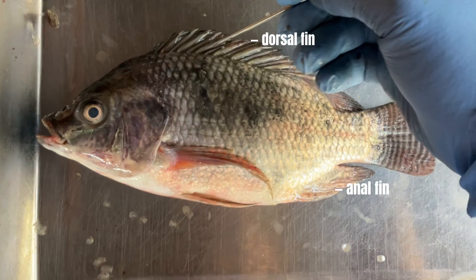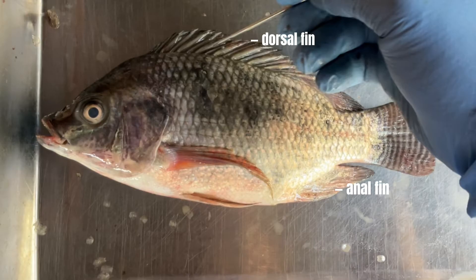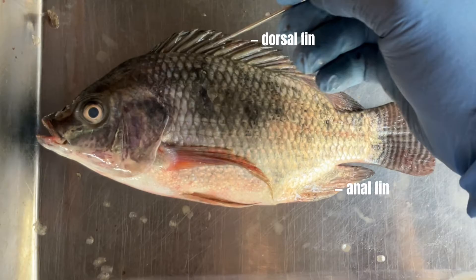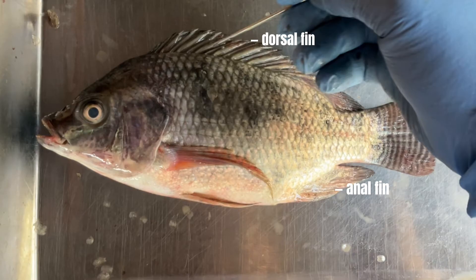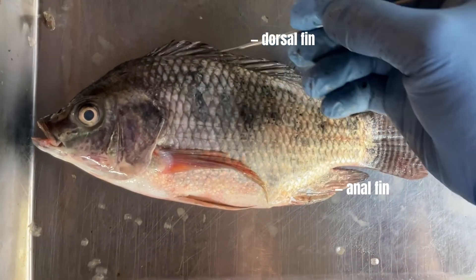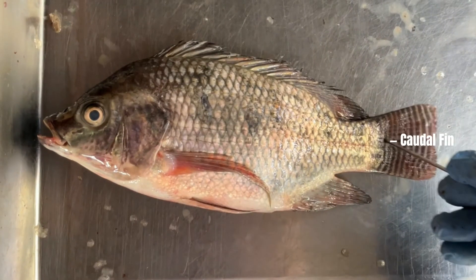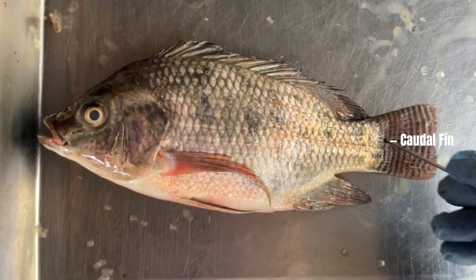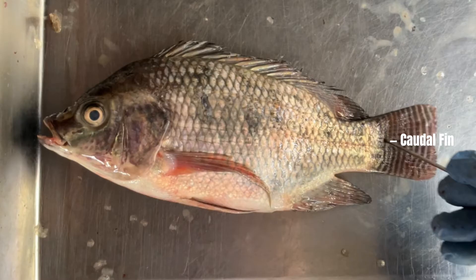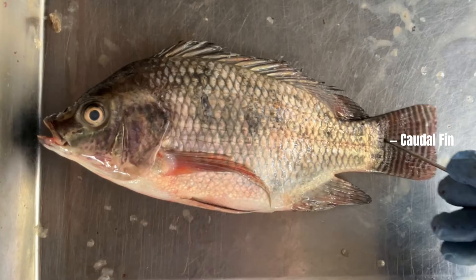The dorsal fin, located on the fish's back, provides stability and balance while swimming, helping to prevent rolling or tipping from side to side. The anal fin is located on the ventral side of the fish near the posterior end of the body, just anterior to the tail fin. Like the dorsal fin, the anal fin contributes to stability and balance during swimming, helping to maintain the fish's trajectory and orientation. At the rear end of the fish, we find the caudal fin, also known as the tail fin. This powerful fin propels the tilapia forward through the water with precision and speed, essential for evading predators and catching prey.